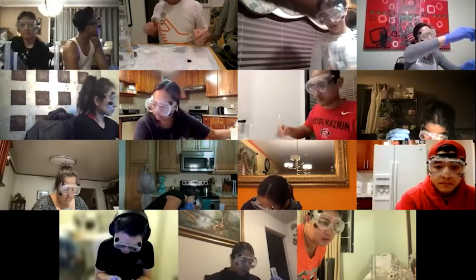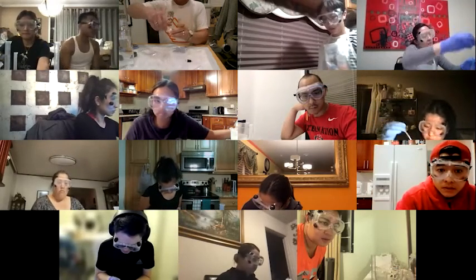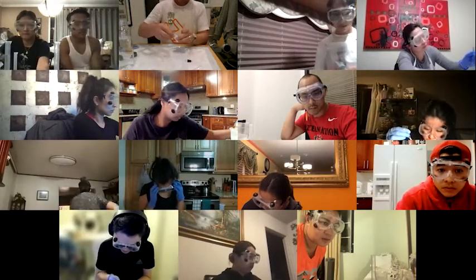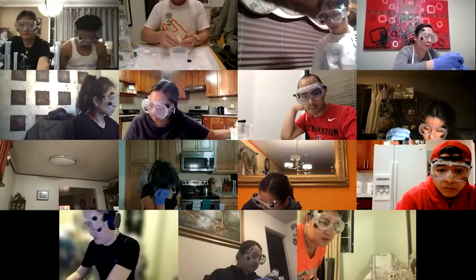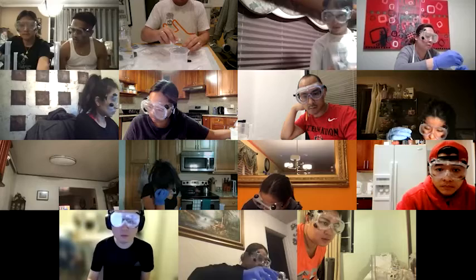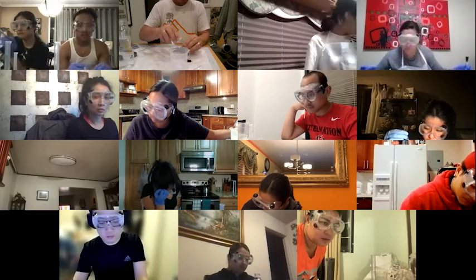Here, let me see if I can get this to work with the more dilute stuff.